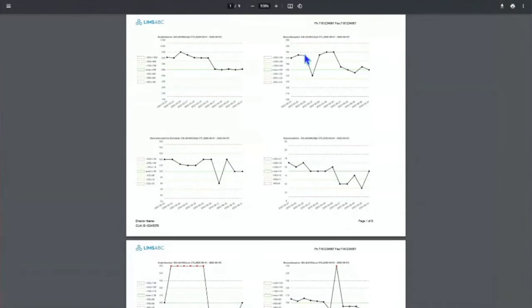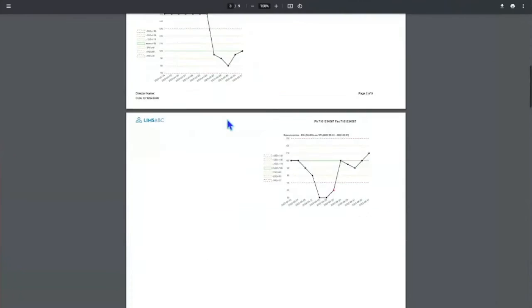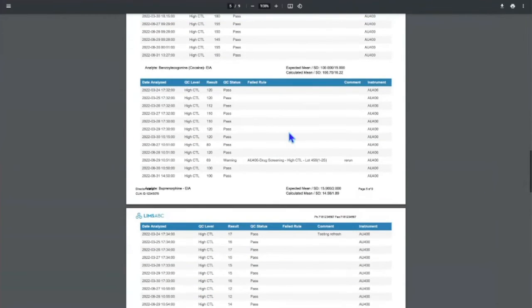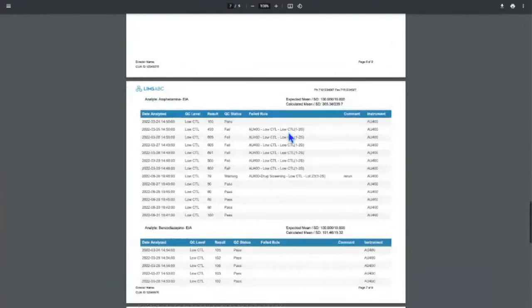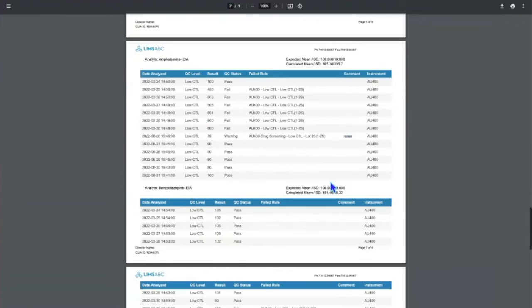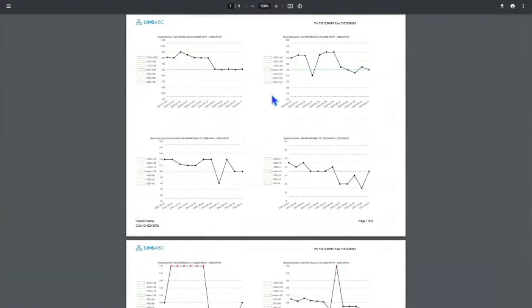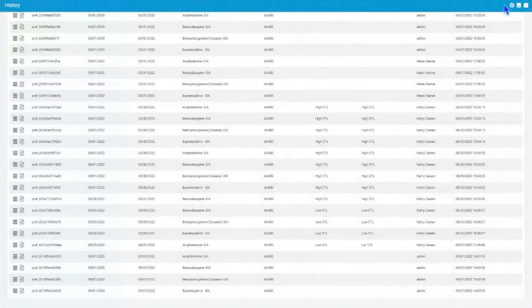When you approve it, you have all of the QC charts, and then at the end, you have all of the QC results and any comments that you put in. You can see here there is a comment column, all of the comments that you've put in for the QCs that, let's say, they failed or you had warnings. You put a comment that you've retested or whatever. Like in this case, you see this was a rerun, so everything was fine. So you have all of that. Obviously, you can print these and have them on paper. I mean, you have the PDF, so you can see who did it and when.